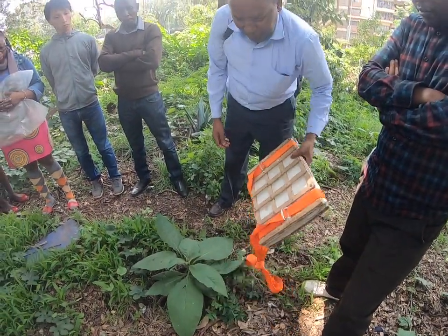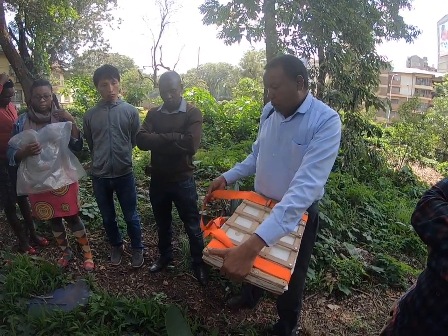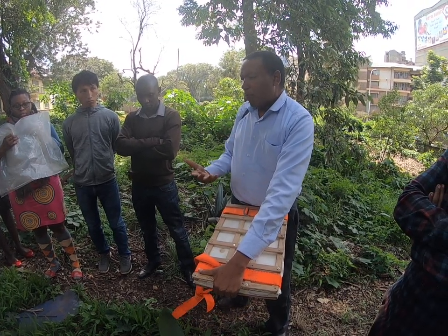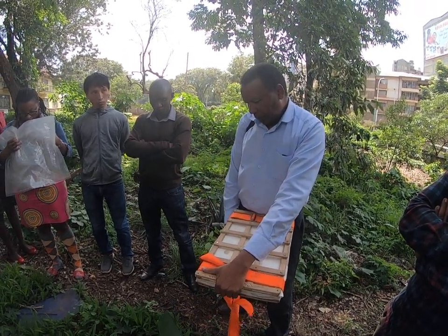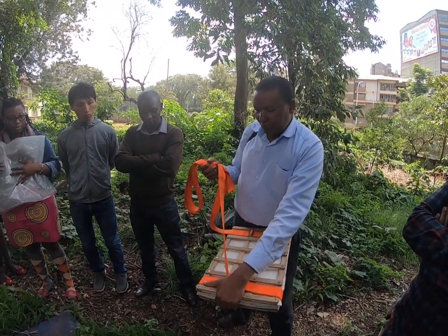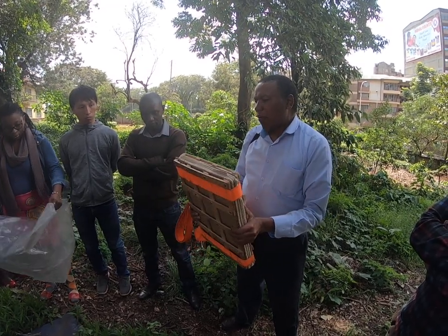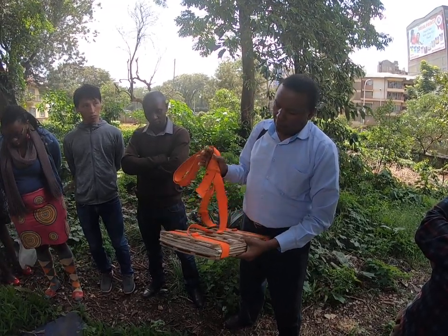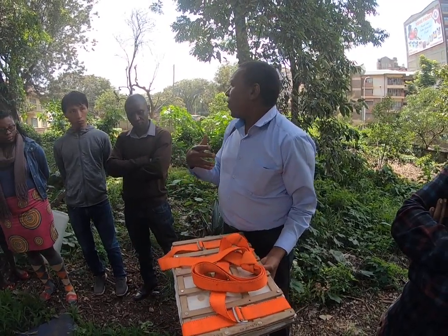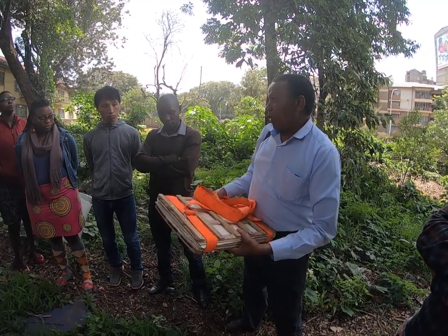This is a plant press, and the purpose of the plant press is once we are shown the specimen or a sample of the food plant and we don't know the name in scientific terms, then we pick a sample of the plant, dry it here, and after our field studies we bring this to the herbarium.